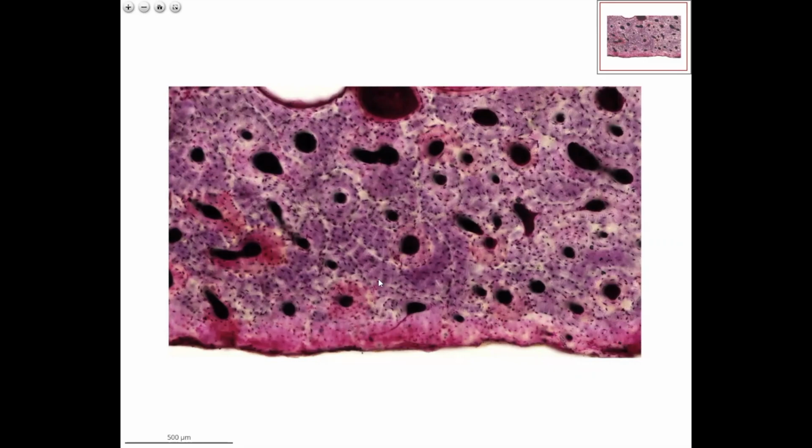This is the compact bone stained with Fuchsin. You see here lamellar bone. Lamellar bone has two types, the spongy bone and the compact bone. Of course, from the spongy bone, we couldn't make a ground bone. We can make it only from the compact bone.